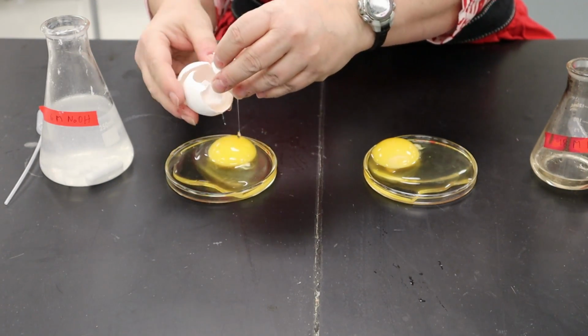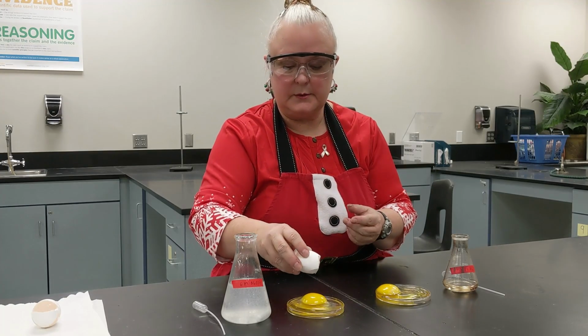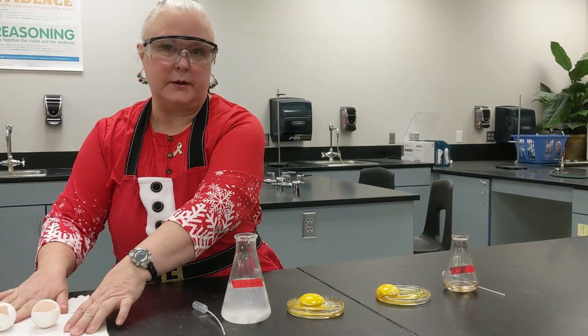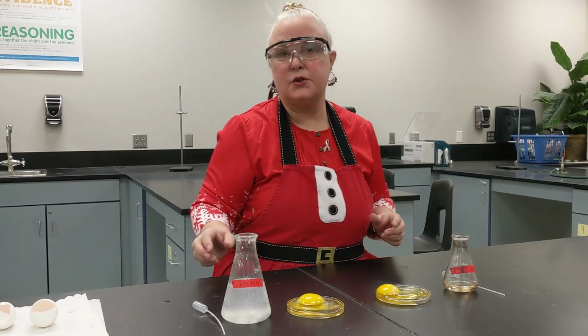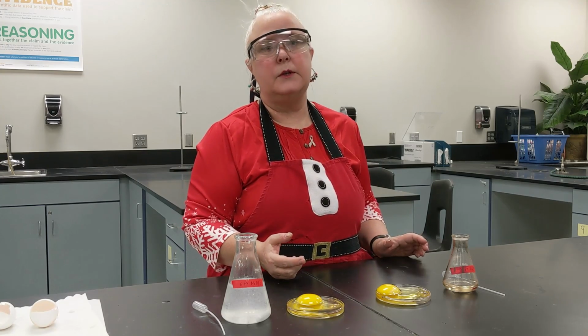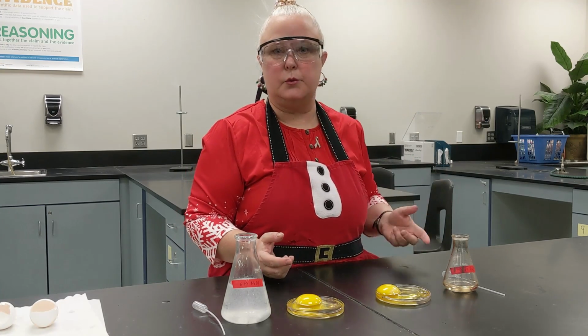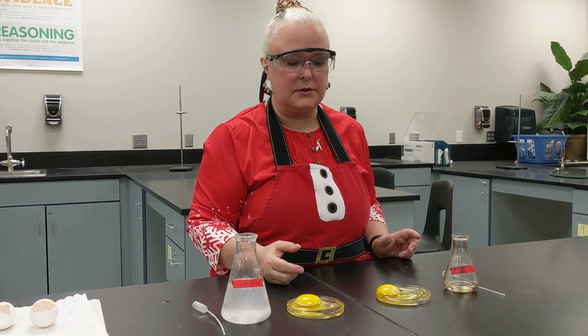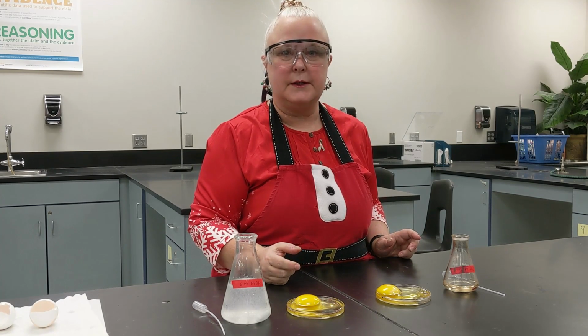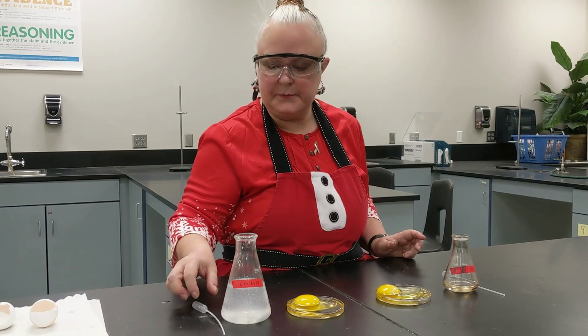And so we're going to do a demonstration using eggs. We could do this with cow eyes or anything like that, but this should show just as well. In my class, I know that we have so many different things in the room just in case you have something in your eyes. But the best way to do this is to wear goggles. Even Mrs. Claus knows that.